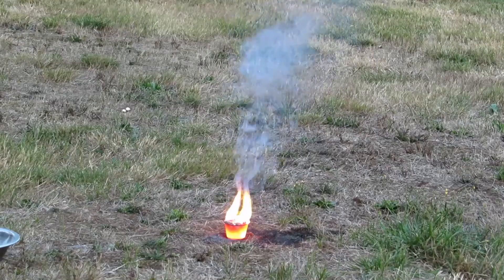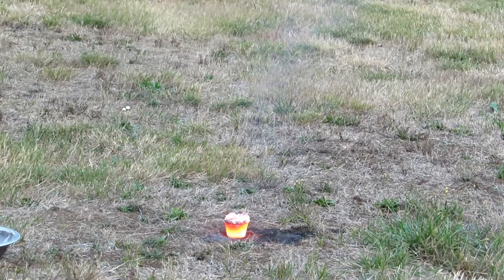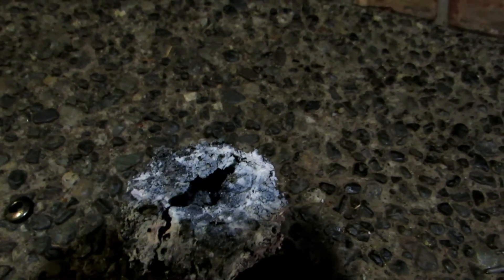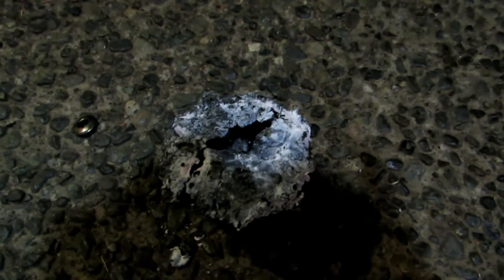The reaction looks like it's just about done — you can see it's glowing red hot. This thing stayed hot for so long that I had to go babysitting before I could come back and it was cool enough to do anything with it. And this is actually a very good sign. It got so hot it melted the aluminum oxide, which has an extremely high melting point. So I'm really hoping it was hot enough to actually melt the silicon into a blob.